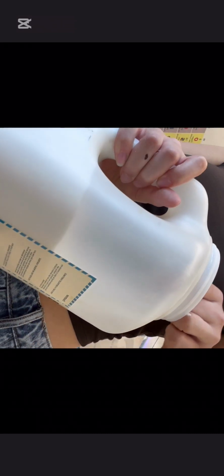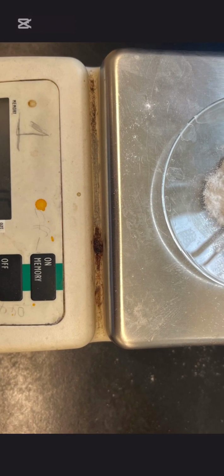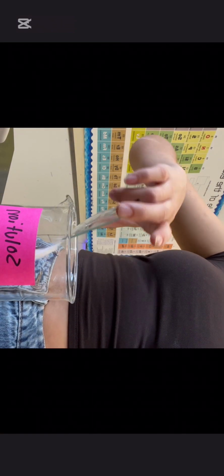I now began to make solution B, another 600 milliliter beaker, my glucose or dextrose, and water. I put 1.5 grams of dextrose onto the scale, and then I poured another 100 milliliters of water. I again made sure to mix the solution to make sure that it was all dissolved.